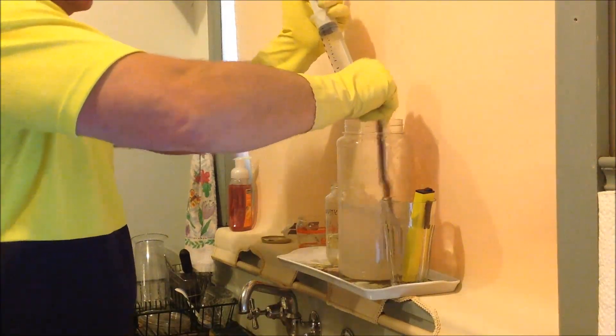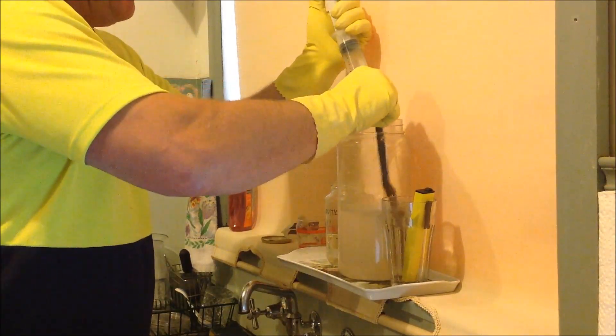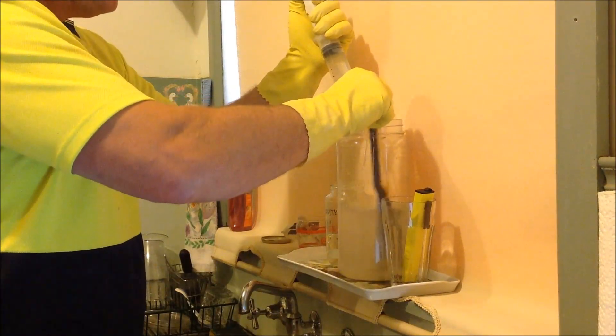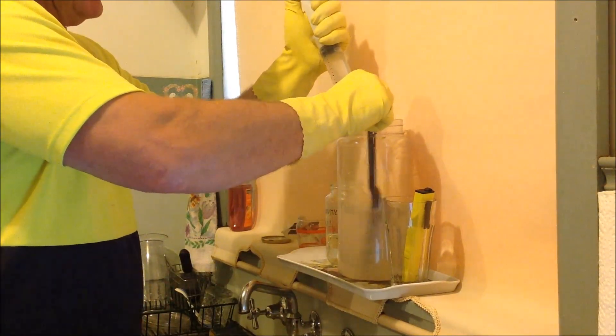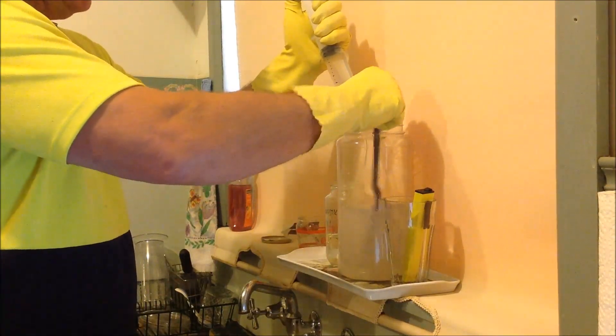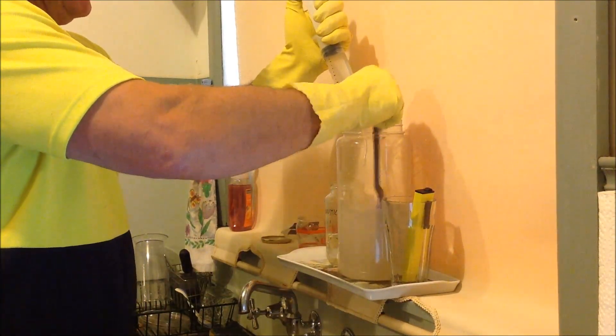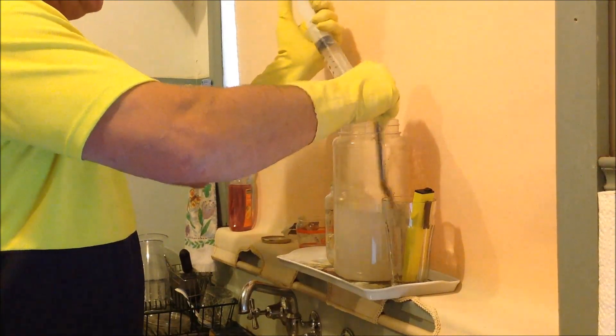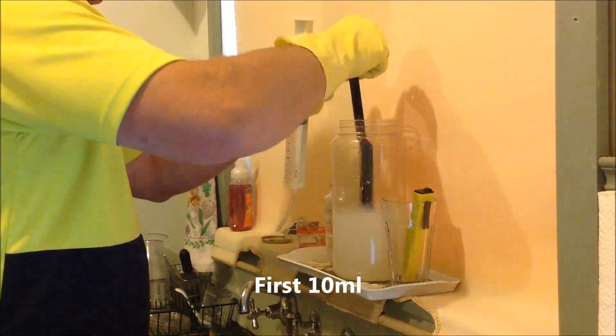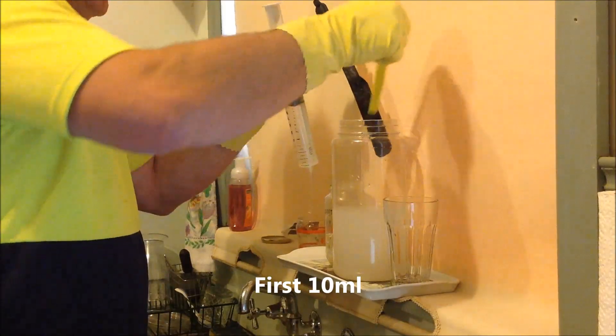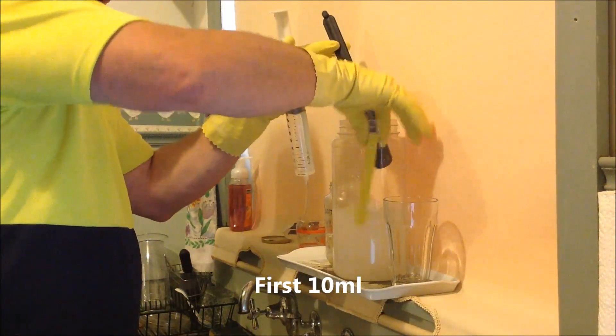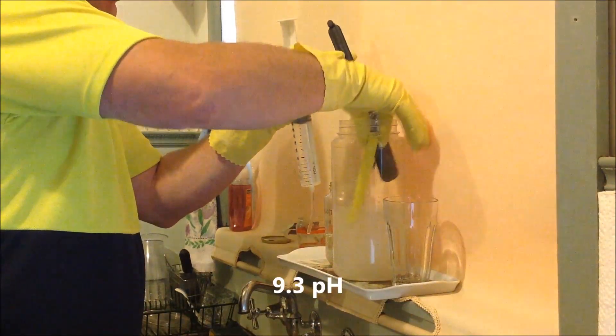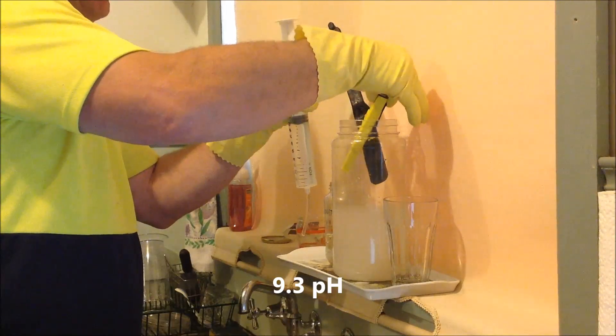If I continue to stir that, that may even dissolve again, redissolve, because really this is a reasonably strong solution and around each drop that you put in it is quite strong, and so you get a precipitate coming out of solution. So I'm going to pull this down to even just 10ml and just take a reading for you. We really should have been designed with three or four hands. I'm making my own mechanical stirrer which I'll use. So this is 9.3 already.